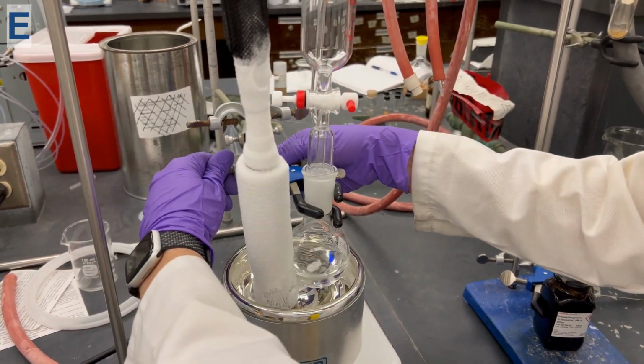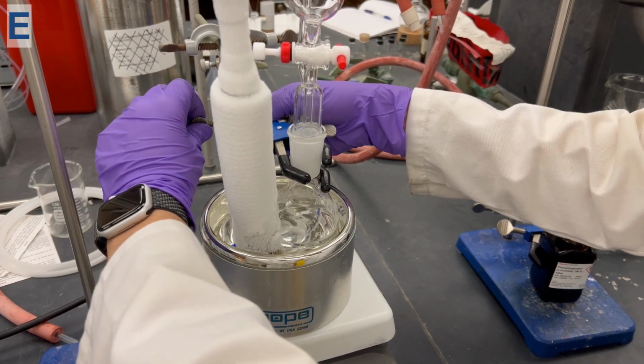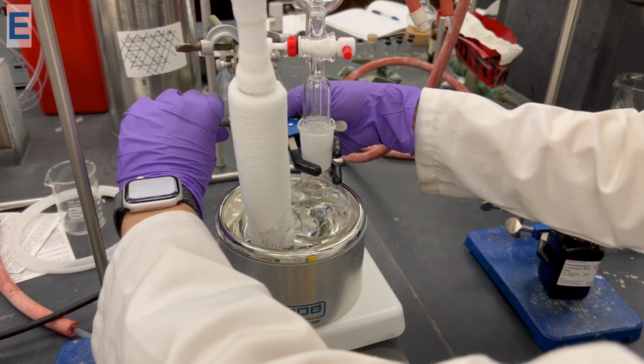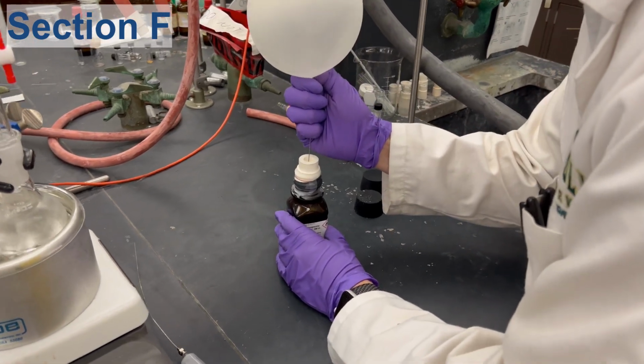After adding the solvent and starting material together, make sure the starting material is completely dissolved. After the starting material is fully dissolved, drop the round bottom flask into the chilling solution. While the solvent and starting material are cooling, the Grignard reagent can be added to the addition funnel.